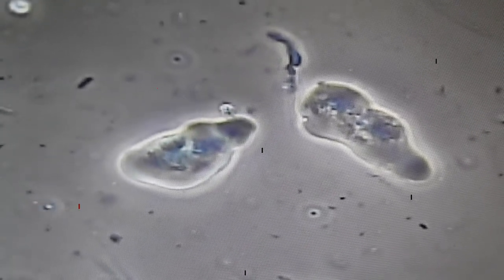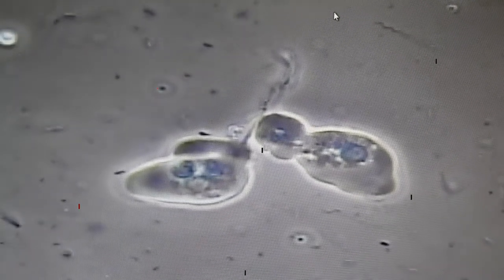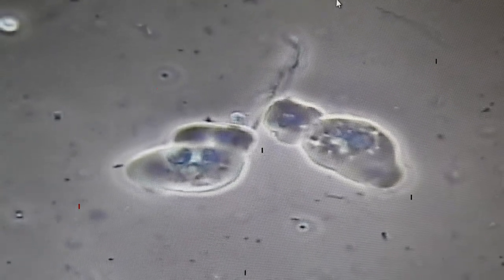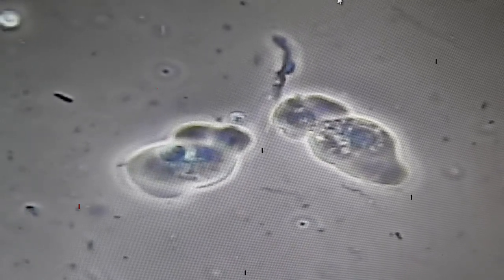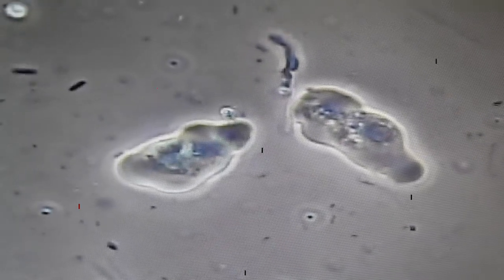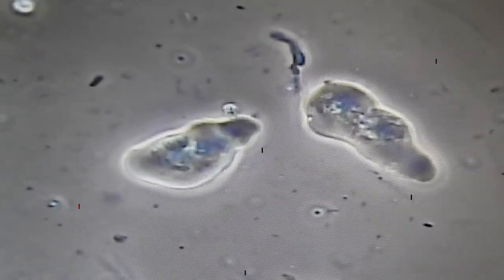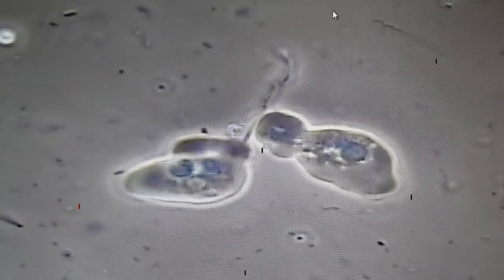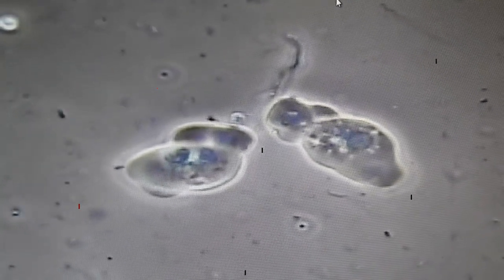You'll see some surrounding spirochetes. Clearly, amoeba do not belong in the mouth. They don't belong in the gingival pockets. This is a serious infection, and something you wouldn't know is going on in the mouth without having a microscope to be able to take a look at this.